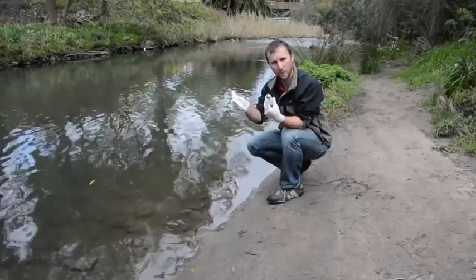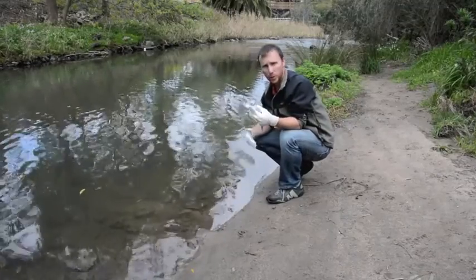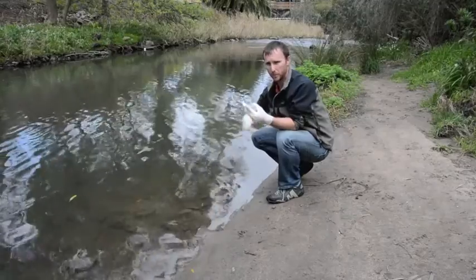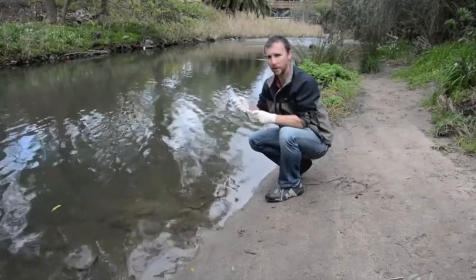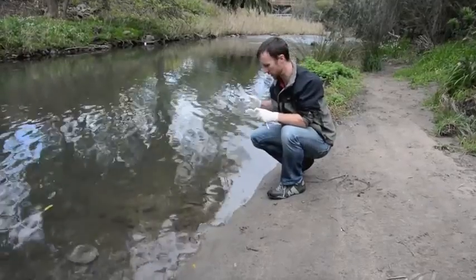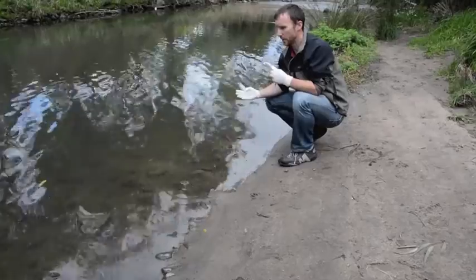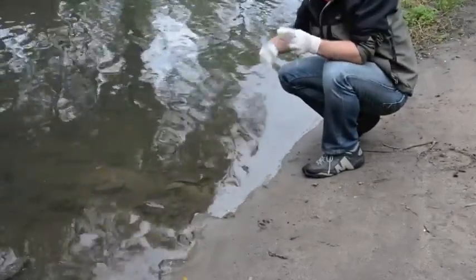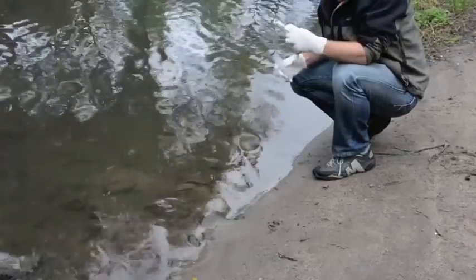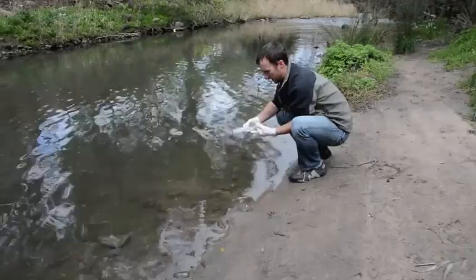I've got my labeled filter and syringe ready to go. Wherever possible, you don't enter the water because that can potentially contaminate between sites. Stay out of the water — the only thing that should enter the water is the tip of the syringe. Also try to pick some reasonably clean water; you don't want to be sucking up a lot of sediment or algae, which will clog up the filter and make it harder for analysis.